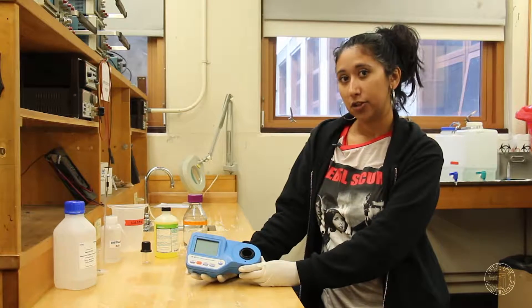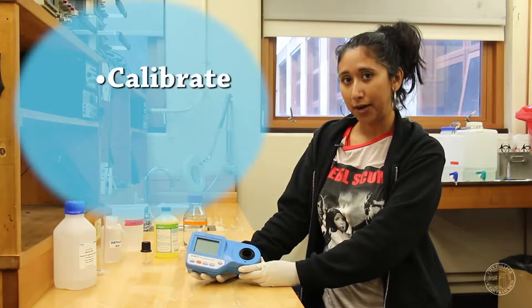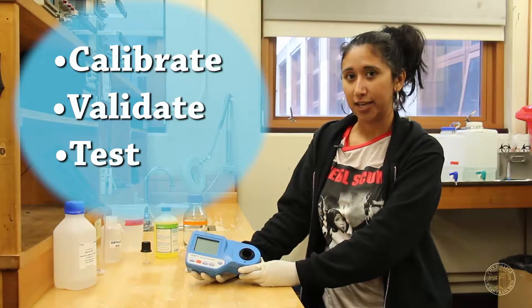In the following, Thomas is going to show you how to calibrate, validate, and test for this parameter.